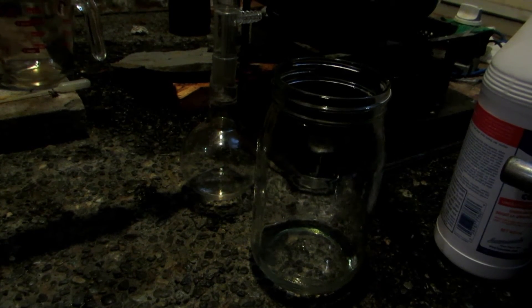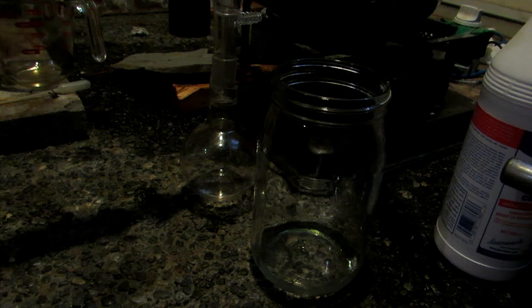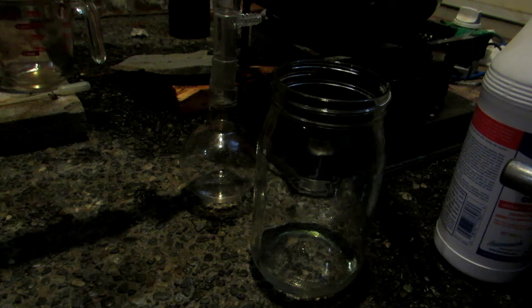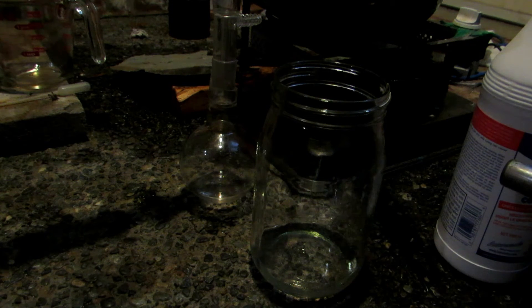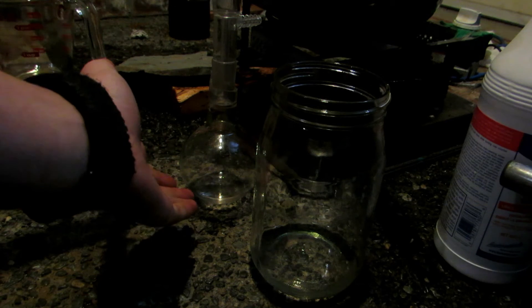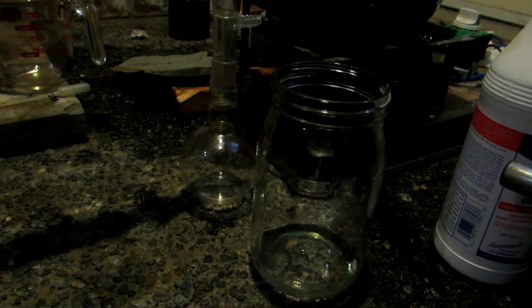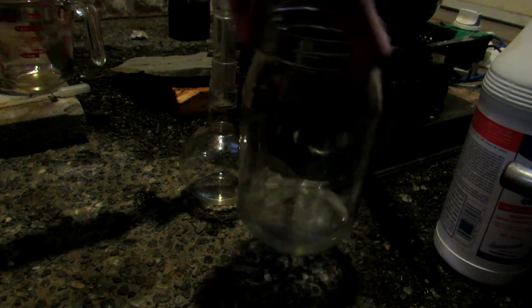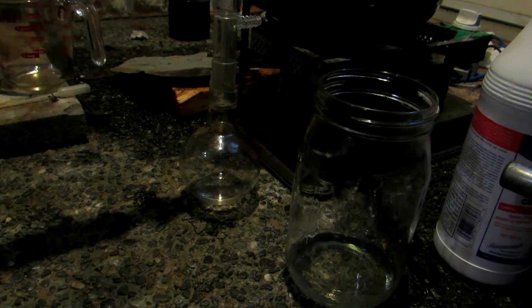I've started collecting the concentrated sulfuric acid, and the first 30 milliliters or so has been transferred to a separate jar. It's still strongly acidic but not concentrated enough yet. What I first did was the tissue test — you take some Kleenex, drop a drop on it after constantly changing out the receiving flask, and if the drop burns through the tissue you know it's a fairly high concentration. I also use the method where you watch the liquid for swirls — the swirls indicate a density difference between concentrations. When the swirling stops, it means it's reached the highest concentration at about 98%. Everything below that threshold has been transferred to the other jar, and now we're collecting the concentrated stuff.